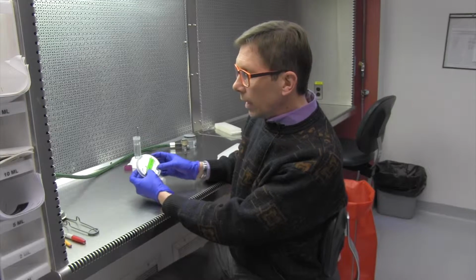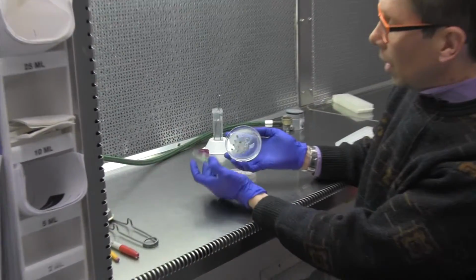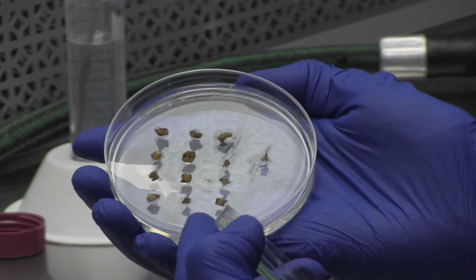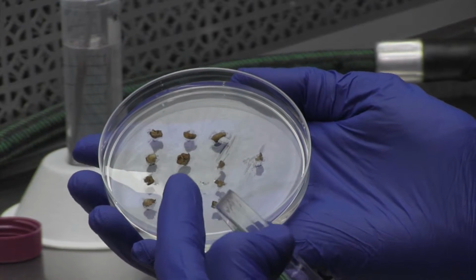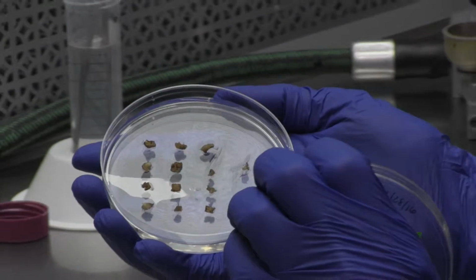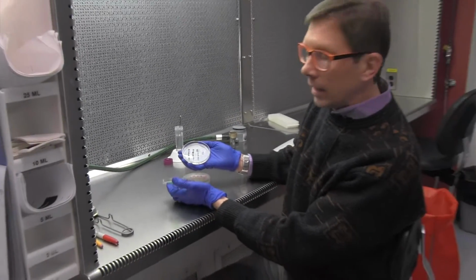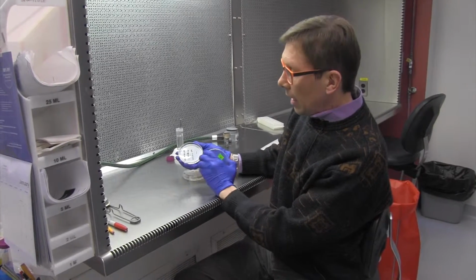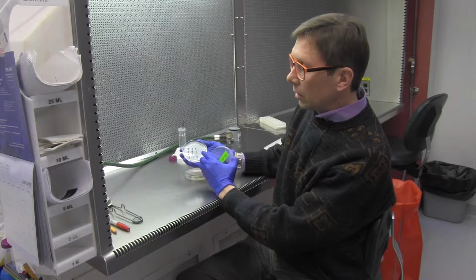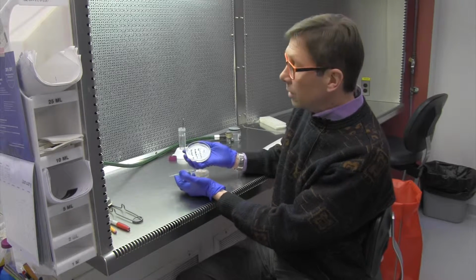And what it usually looks like is something like this, where we would just lay out the 4 different petals from inside the flower, and they will start to grow. After 2 weeks, we transfer them to a different type of media, the secondary callus growth. And then after that, 2 more weeks, we transfer to an embryo development media.